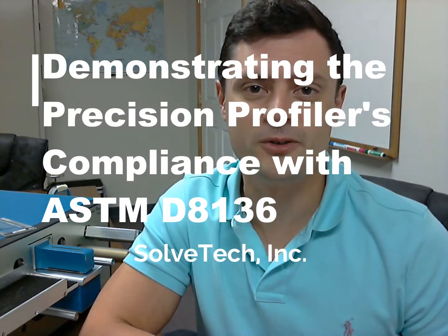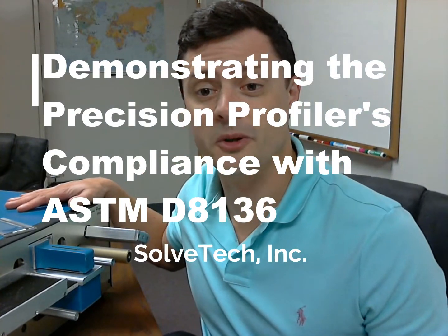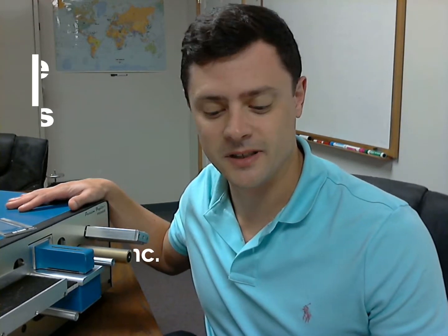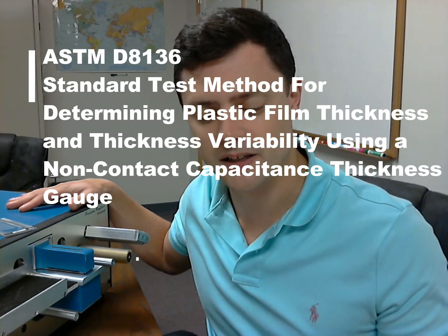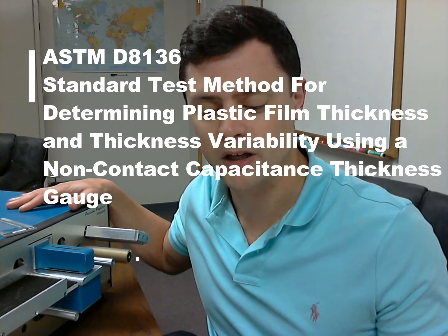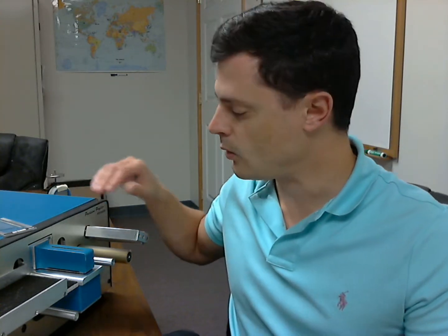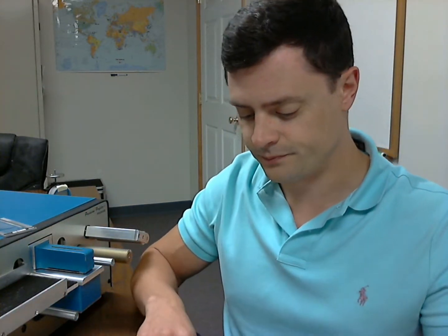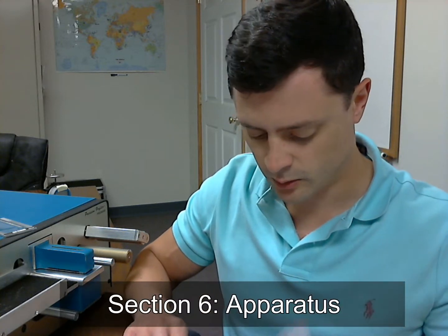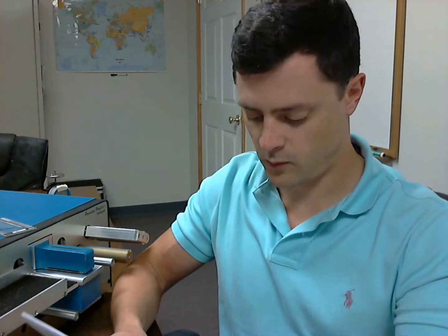Hi, this is Rob Lawrence from SolveTech, and today I'm going to demonstrate how the SolveTech PR2000 complies with ASTM standard D8136, which is the standard test method for determining plastic film thickness and thickness variability using a non-contact capacitance thickness gauge. I'm going to go through section 6, which is the apparatus section, here on page 4 of the standard.